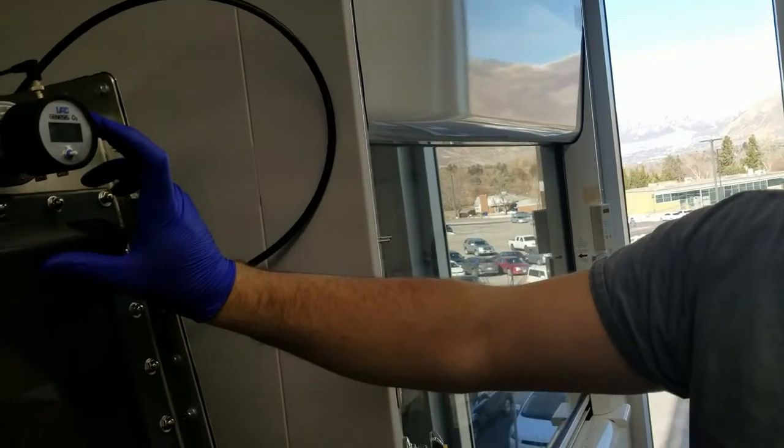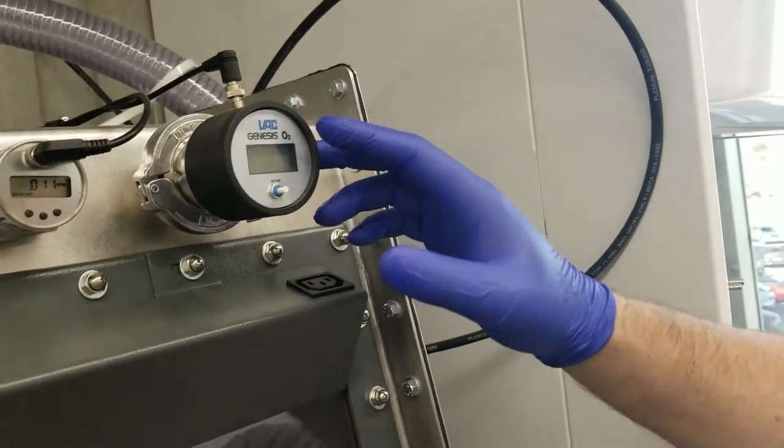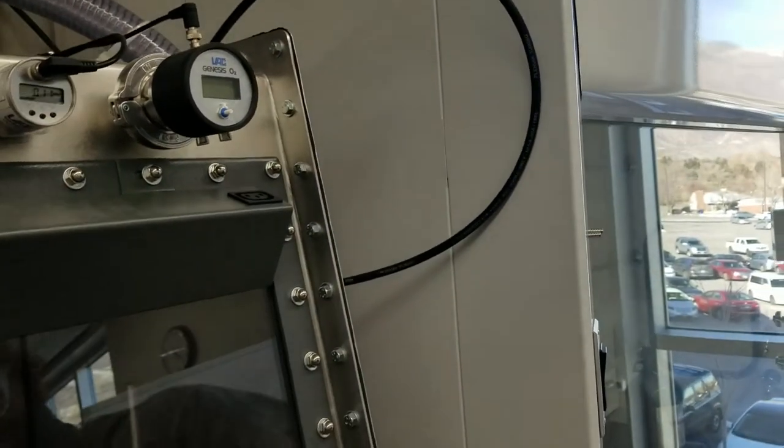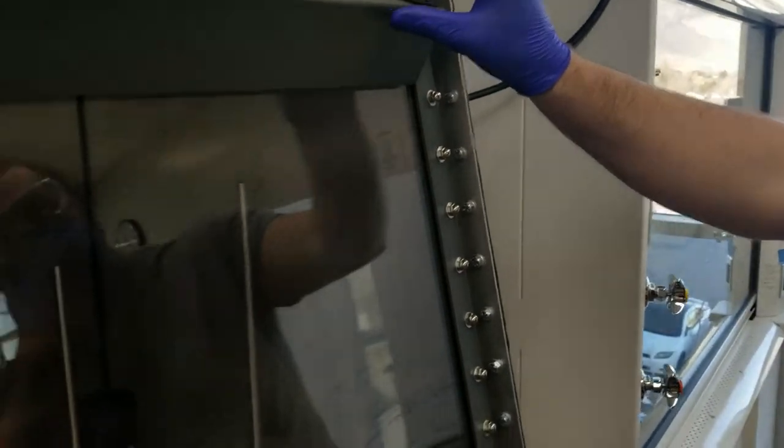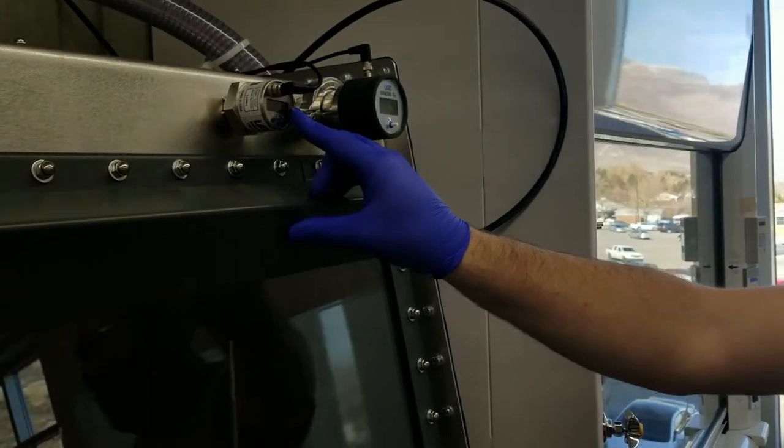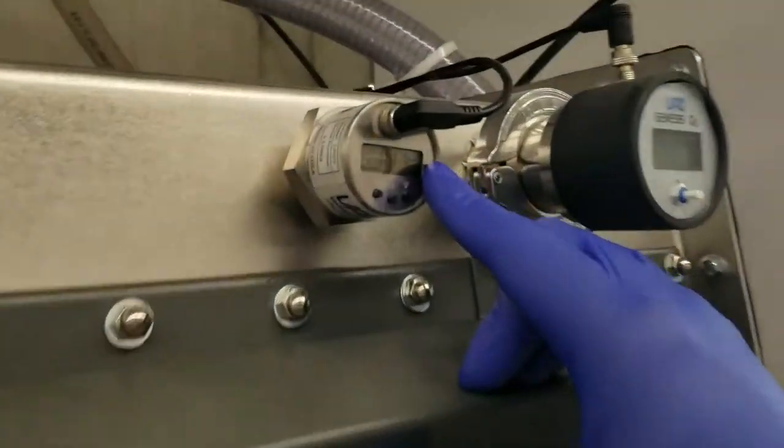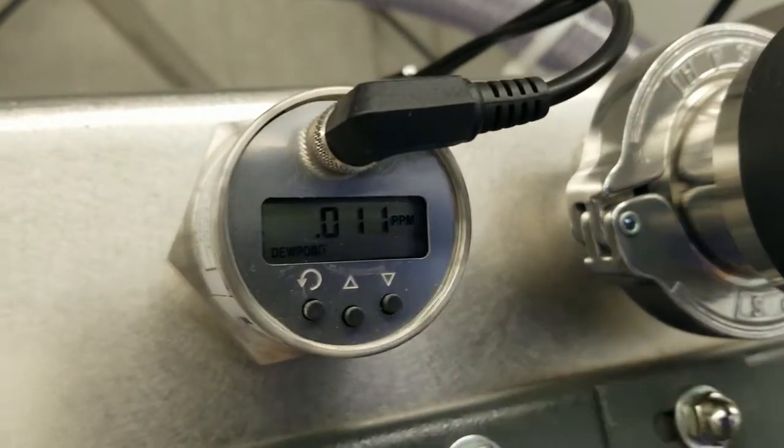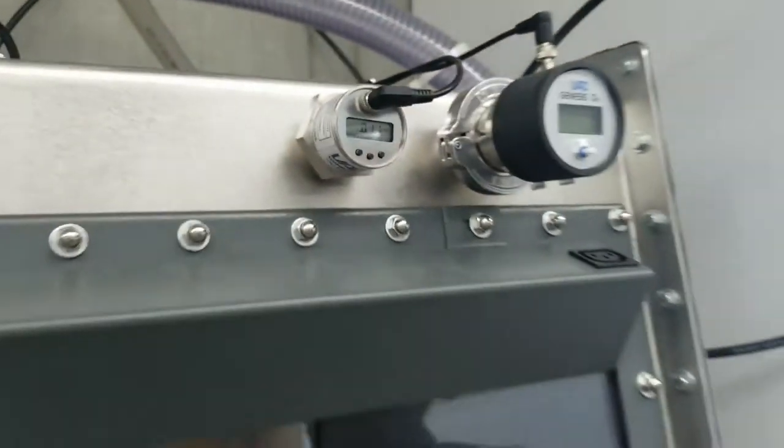But in normal, if it's say 100 or like 50 parts per million, you'll then make sure that's on and it will lower down to less than one. And the same with water over here, which is that catalyst over there. Water has to be less than one part per million, which is currently working right now. And once you've got that working, you can use the glove box. The glove box is ready for usage.